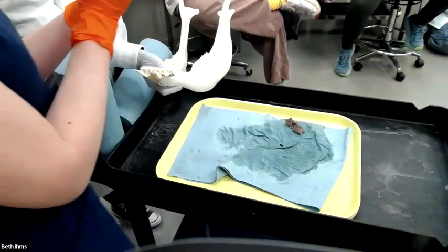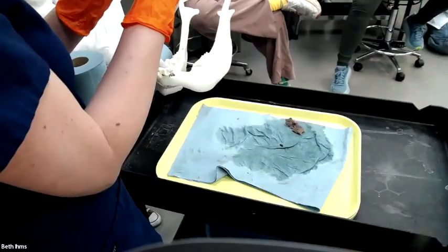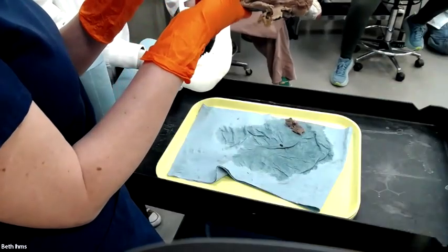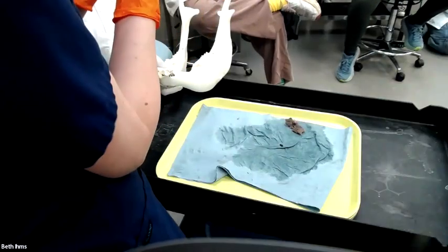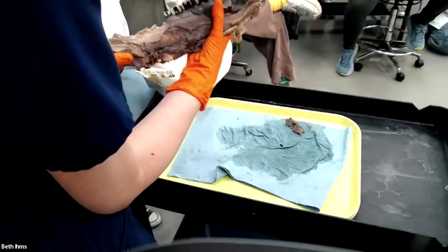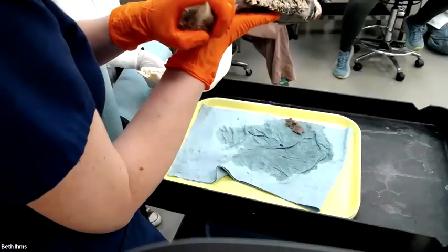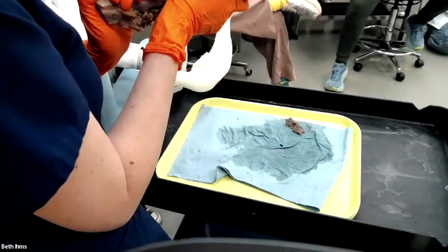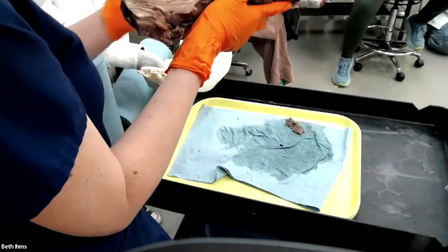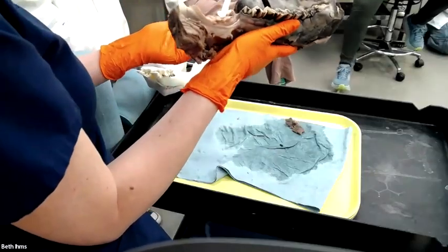So I would say unilaterally, the left half of the mandible is massively expanded and replaced. The bone is massively expanded and replaced by an infiltrative multinodular mass that is extremely firm, poorly demarcated, and dark red, black, gray on cut section.